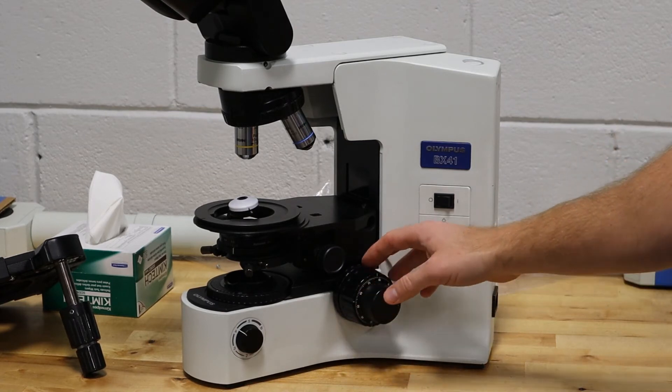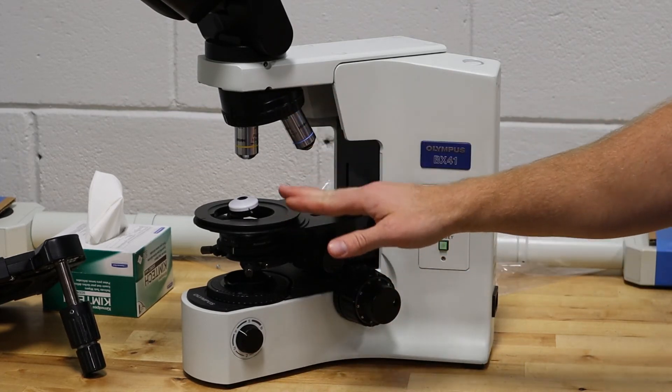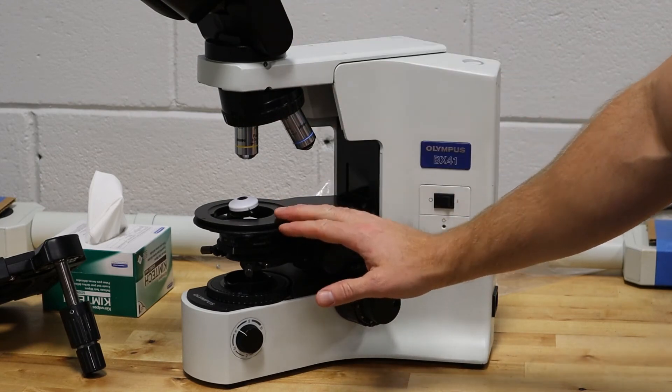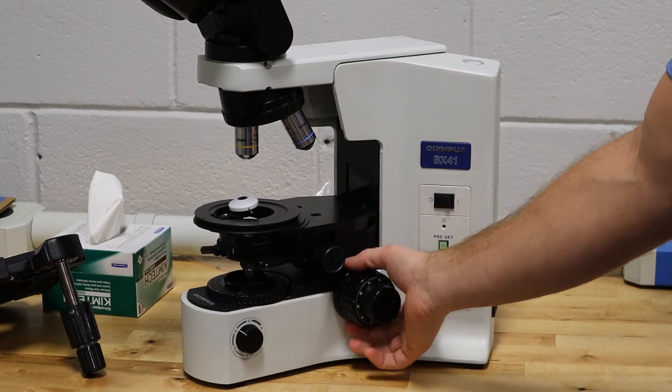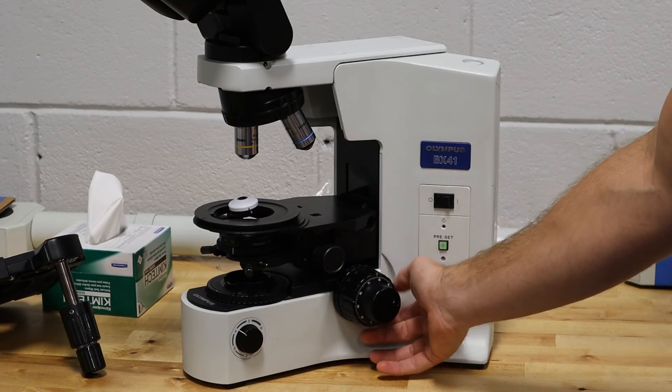Most of the time you'll notice that the stage or image is shifting or falling or not holding focus at the higher magnifications and that's because of the tension ring.